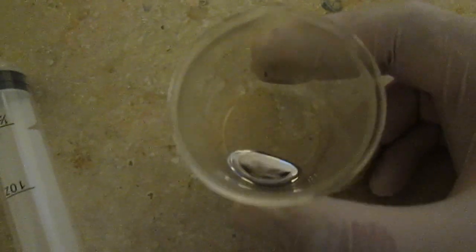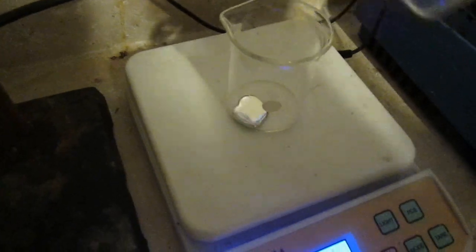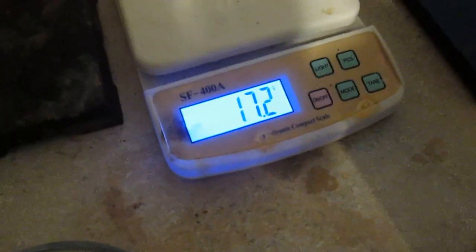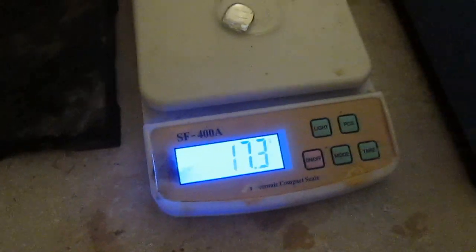I put a bit of cotton balls in a syringe to filter this — it's really a very small amount of mercury. After all these efforts and all these ways to dispose of it safely, I only got about this much. Multiple filtrations and it doesn't look like much. Let's see how much this is — the whole 17.2 grams. Yeah, it's pathetic.